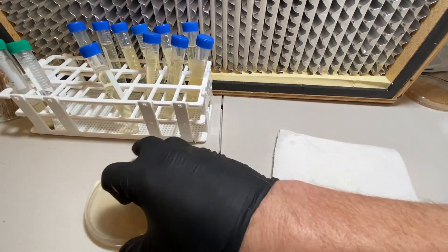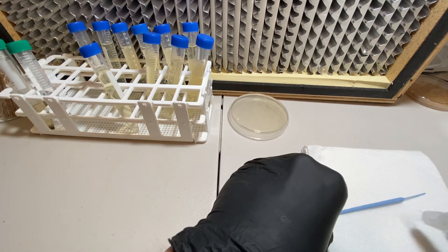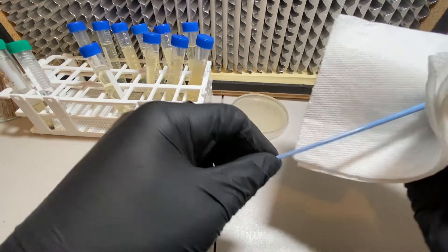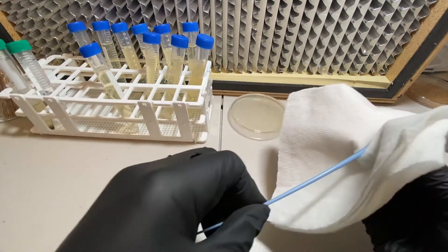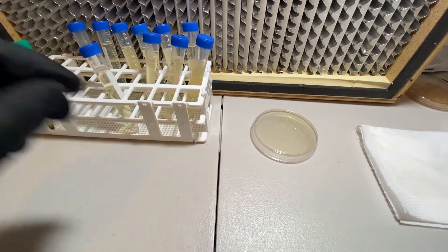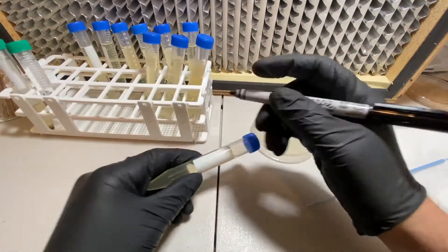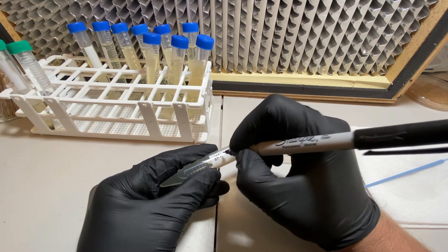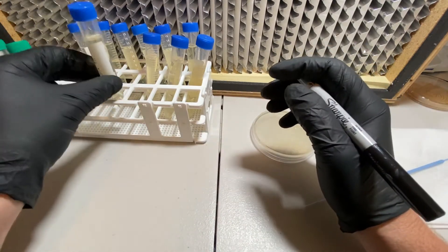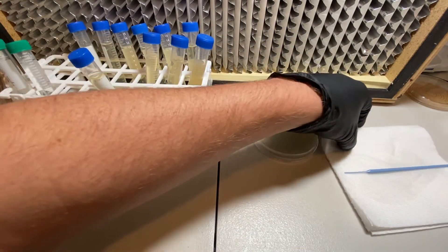I like to wipe everything down with some isopropyl alcohol and set my plate there. I'm going to sterilize this colony picker. I notice from watching my videos that I tend to do this smacking — sorry about that, I need to be more mindful of that. Before we proceed, always a good idea to label. So this is going to be the DH5 alpha strain of E. coli, and today is September 1st. This will be what we use to create our seed culture that we can put on our plate tomorrow.